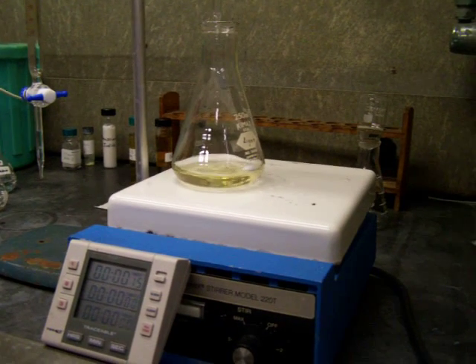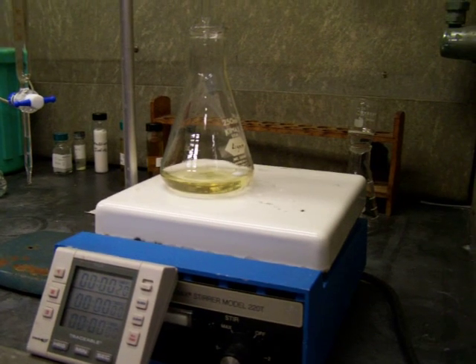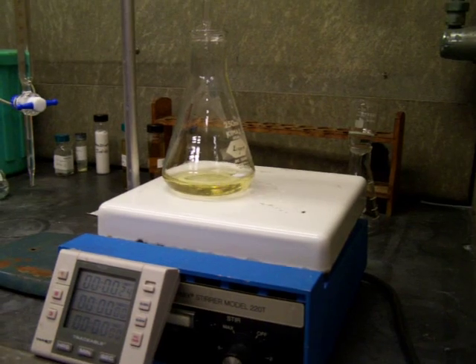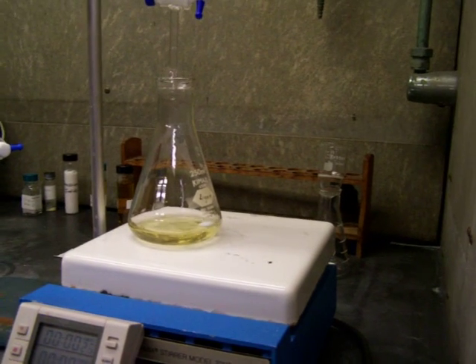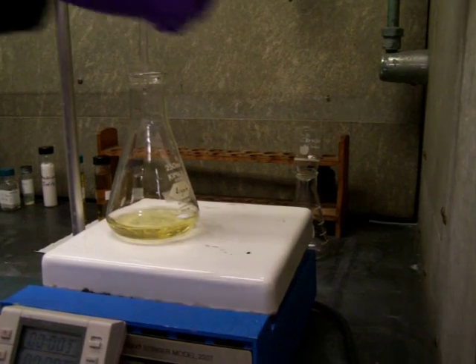Okay. Keep an eye on your level of the silver nitrate. I think it's too fast. It's getting darker and darker, right? Mm-hmm. And when it gets to 3 minutes, what you do is you stop the spinning immediately, right? You have to stop the spinning. Turn it off. Turn it down.